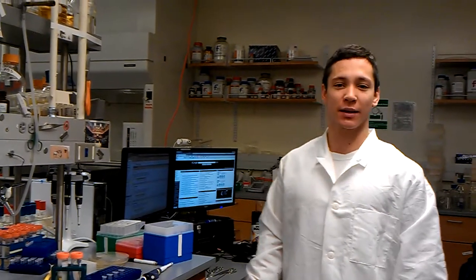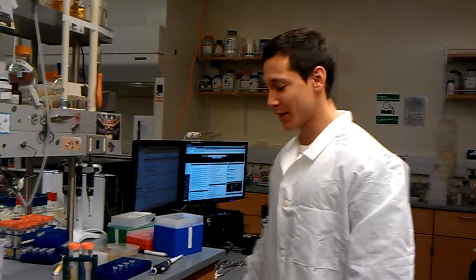Today I'm going to be showing you how to make negative 80 stocks of overnight culture so that you can always have cells ready to go if you need to make some plasmid stocks or something like that.